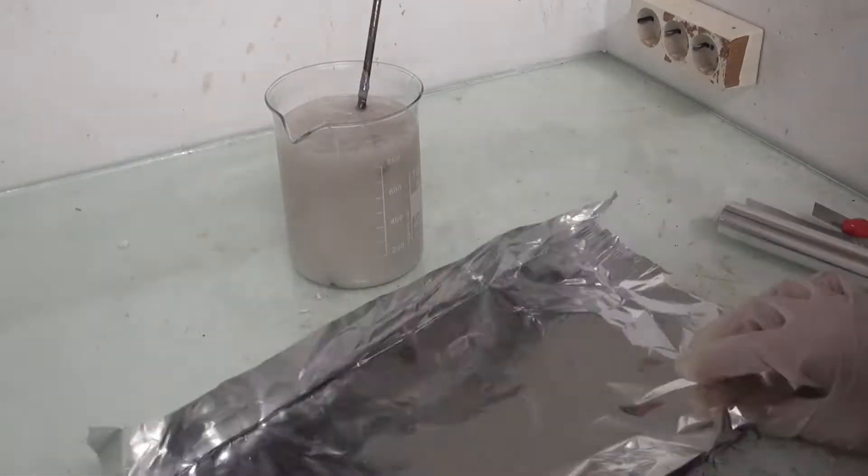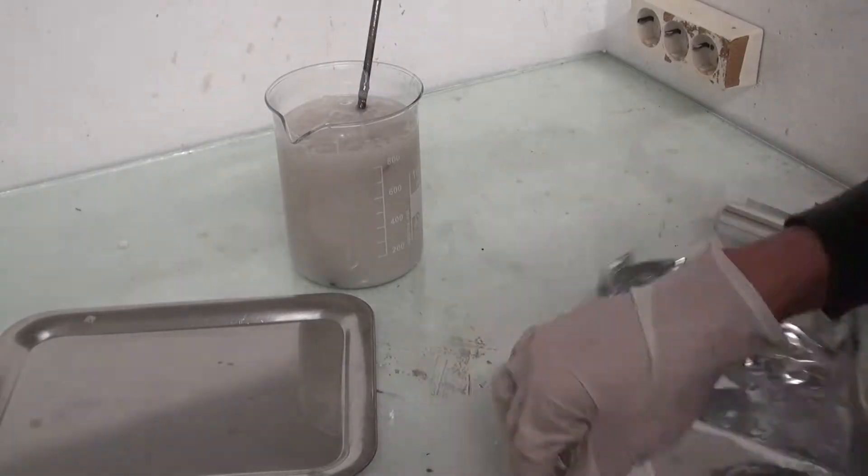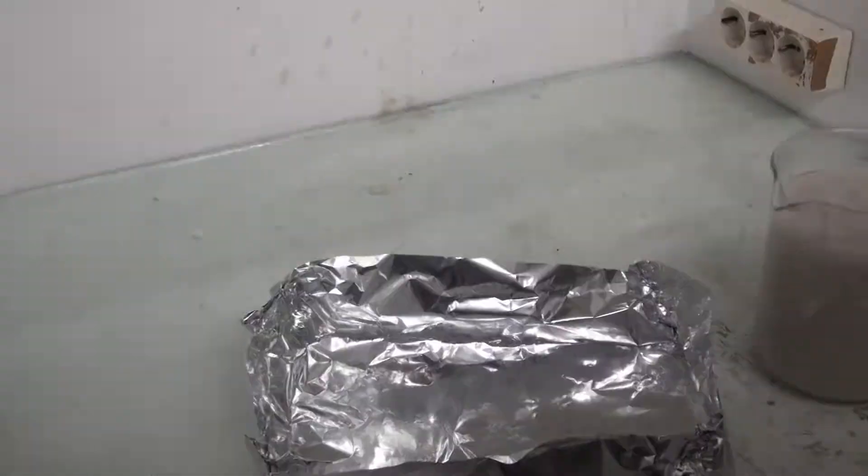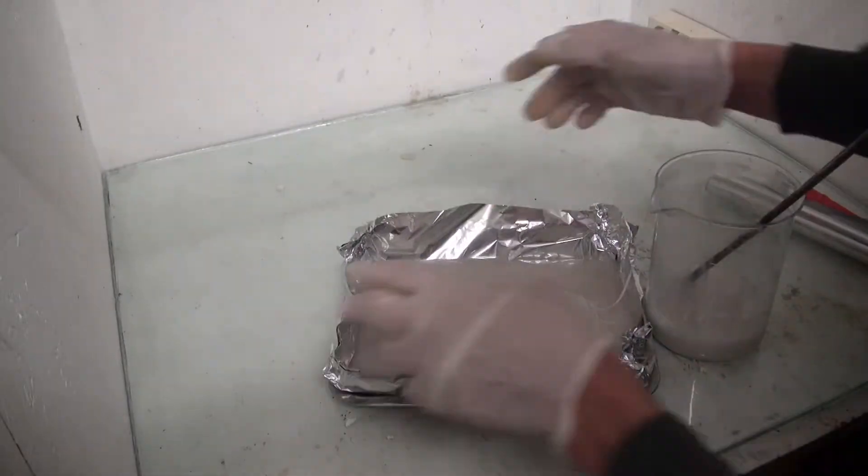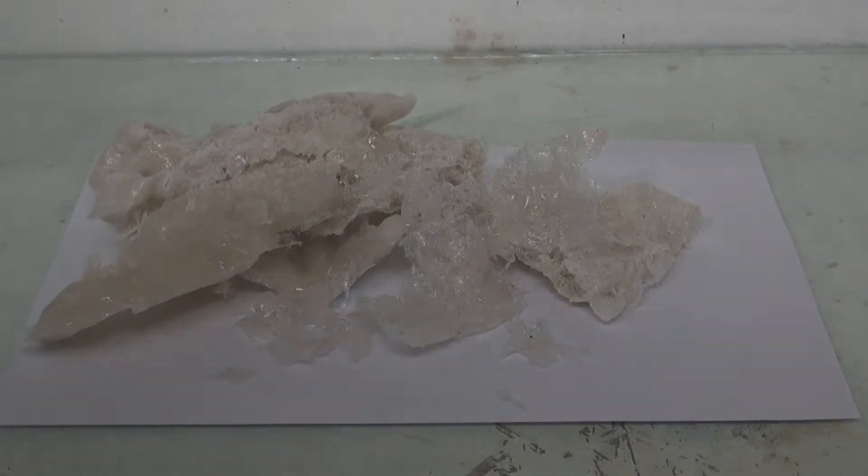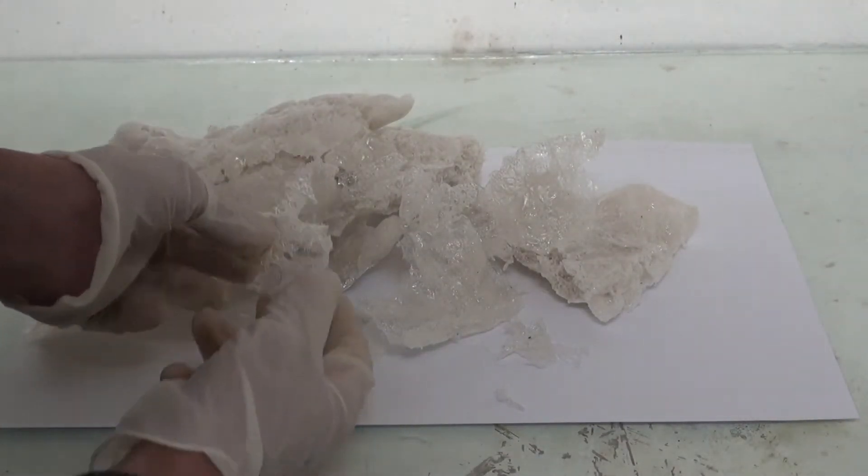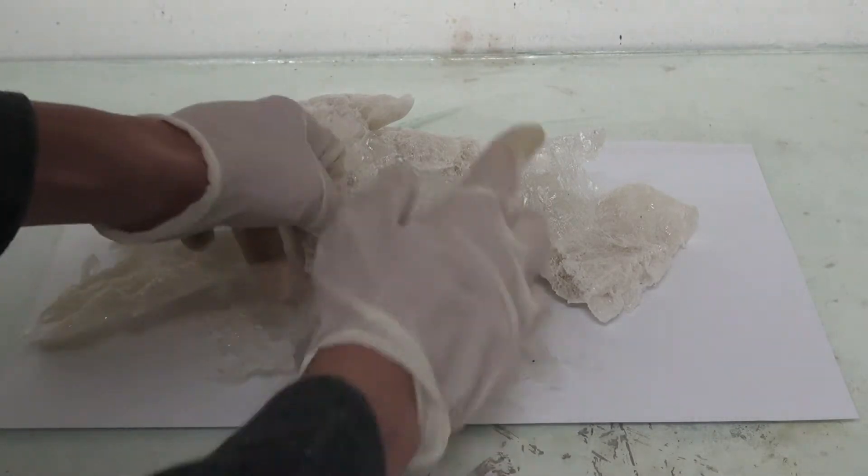When everything was dissolved, the substance was transferred to some aluminum foil, where the acetone was evaporated off. After this I was left with a large chunk of polystyrene.